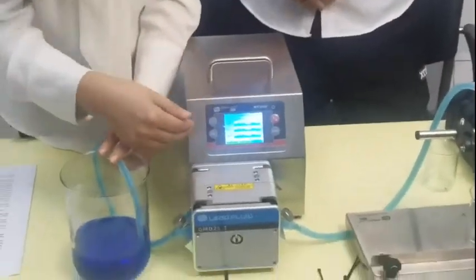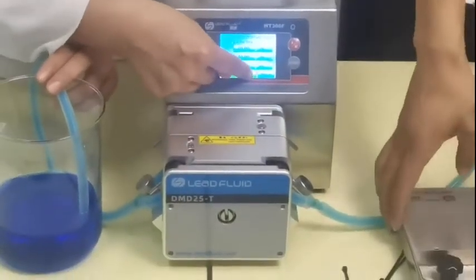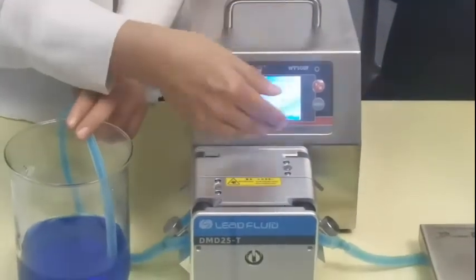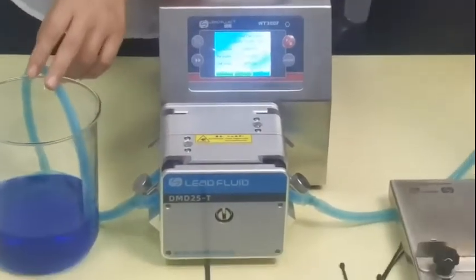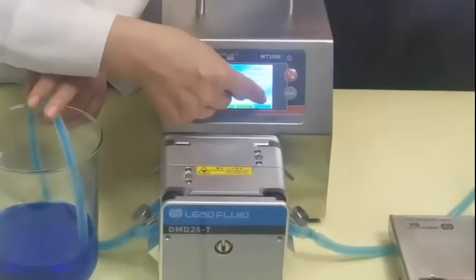So after testing three times, we can press next on the pump and press OK. Under this condition, the pump will memorize the tolerance — then it can give you 60.